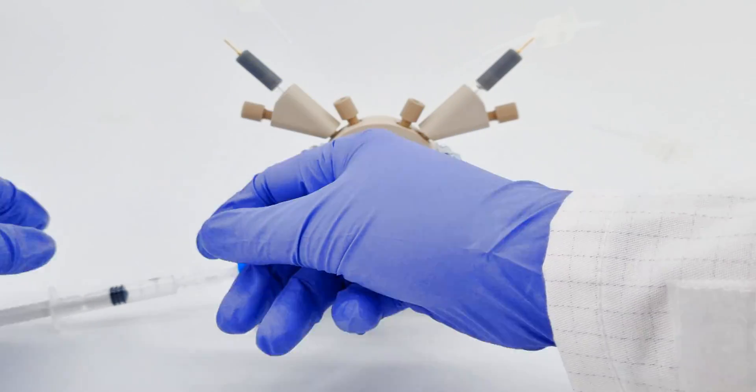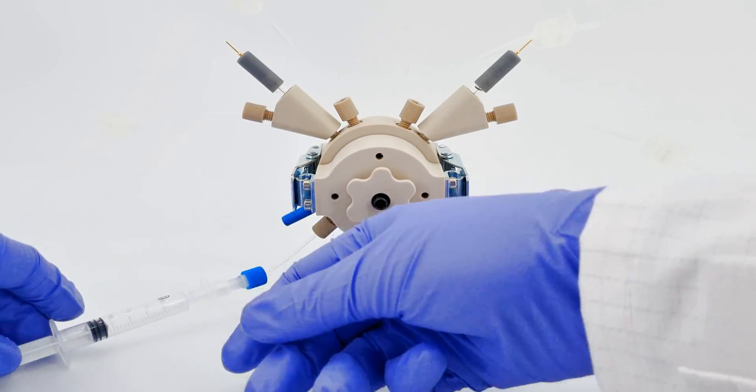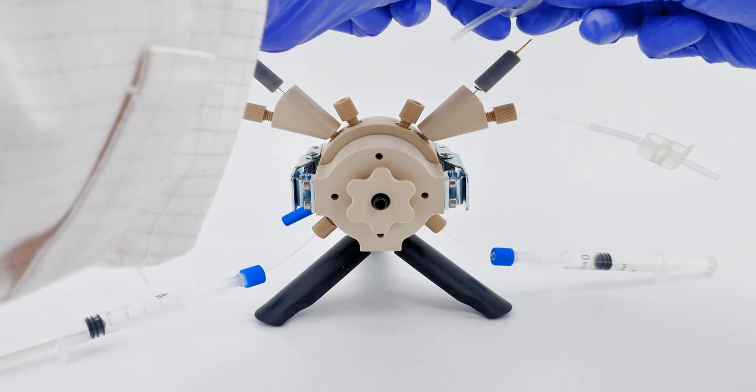Subsequently, release the second clip and extract the remaining electrolyte. Do this for the other half of the cell.